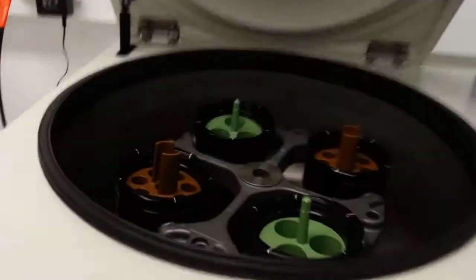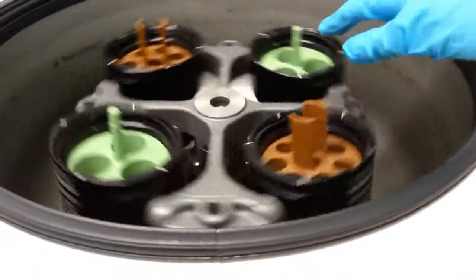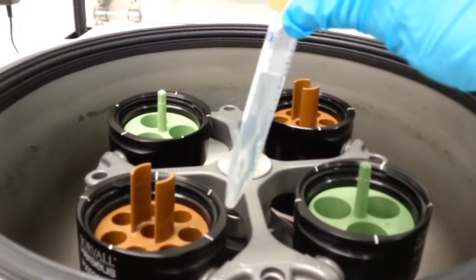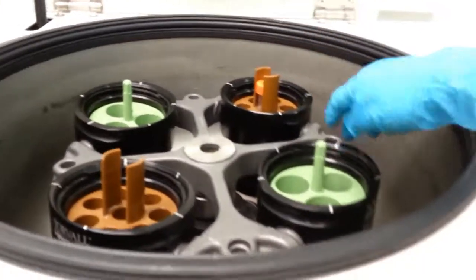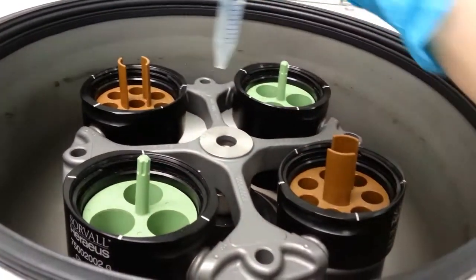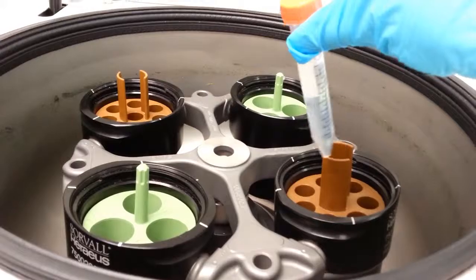This is a centrifuge. A centrifuge is a machine that contains a spinning rotor, and on this spinning rotor there are spaces to put vials or tubes. Take a tube that has liquid in it, and usually it also has cells or bits of cells floating as a suspension in it, though this one is just water. And you put it in the machine, and you turn it on, and it spins around and causes all of the cells or bits of cells to sink to the bottom in a tight clump, and then you can suck off all the liquid on the top and add a different liquid. That's the point of the centrifuge.